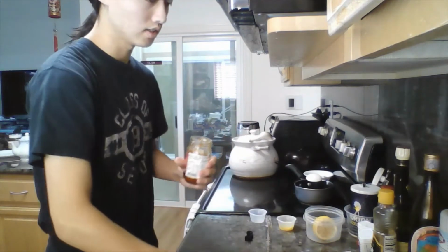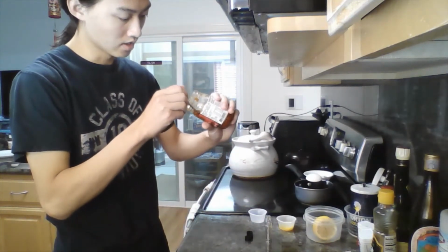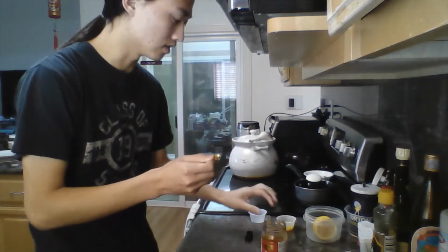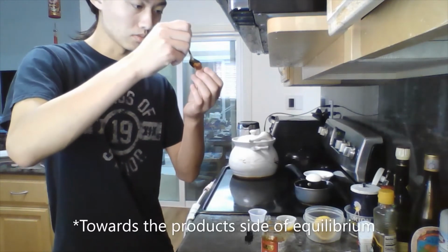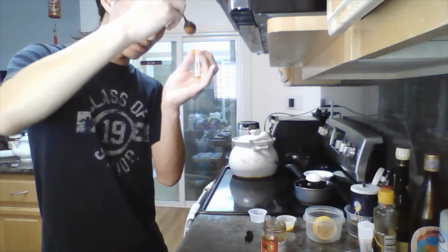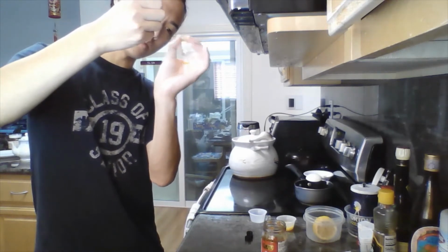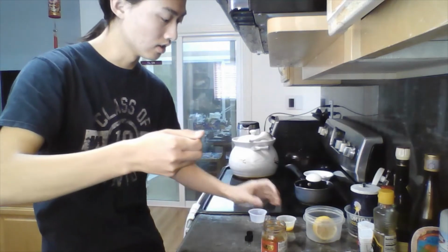Typically, acid hydrolysis is conducted using a very strong acid like hydrochloric acid, but since I'm using such a weak acid, comparatively, citric acid, I'll be trying to shift the reaction towards the products by adding excess acid. So as you can see here, I'm just trying to fill it with acid until it just about fills up the bottom, and I'll be doing this with all the other 2 vials.